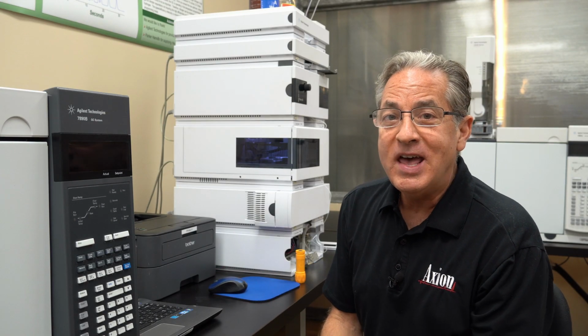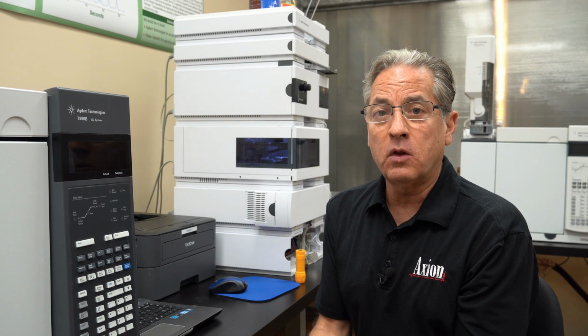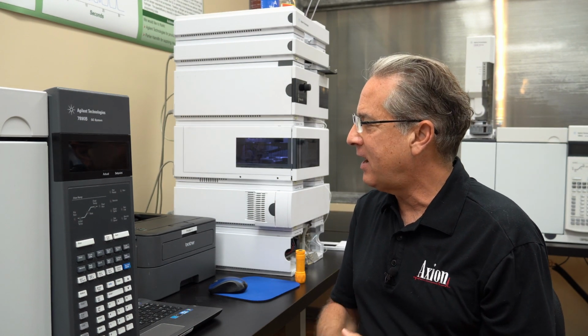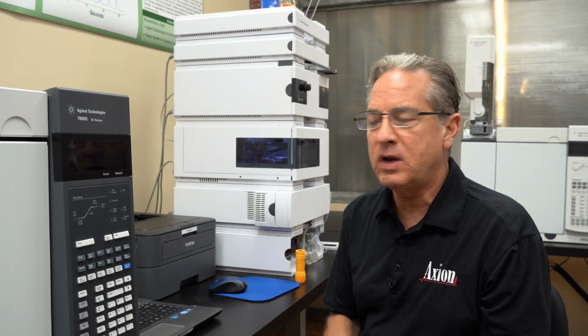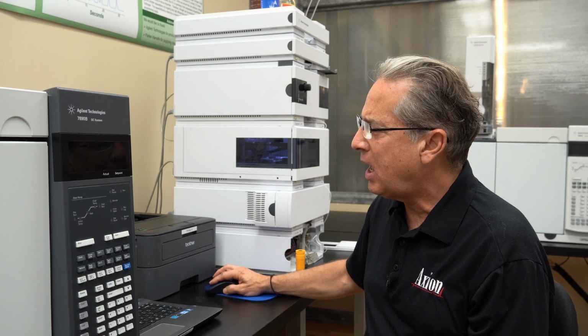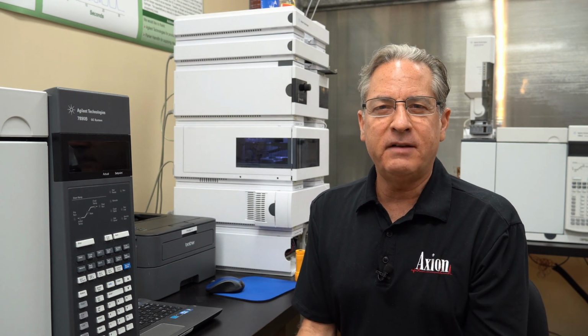Unfortunately, ready for some bad news? They took this out of our software. Yeah, it was there for, I don't know, 10 years, 15 years as part of the software, and then in the newer versions, when they came up with OpenLab, it's no longer there. But let me give you the good news. Agilent has taken this out of the software, but made it into a little free program. So there is something called Agilent Lab Advisor, and I don't know if I can say all the tools, but it has most of the built-in diagnostic tools, most of the tests that I've showed you that are available in the system itself, and that's a free download.